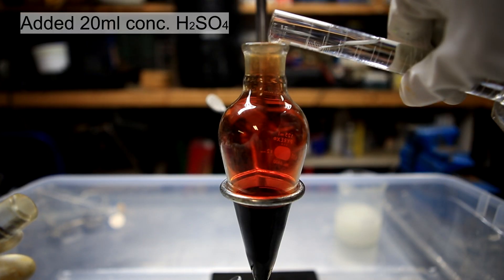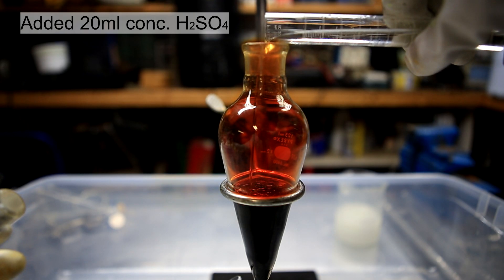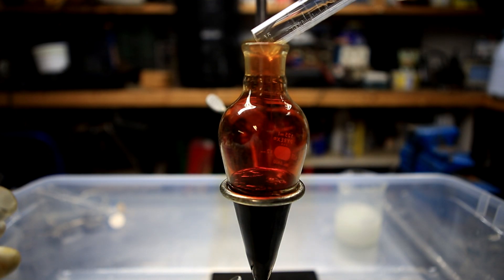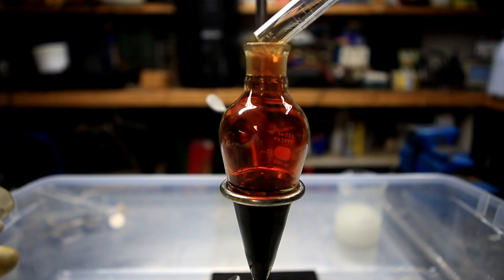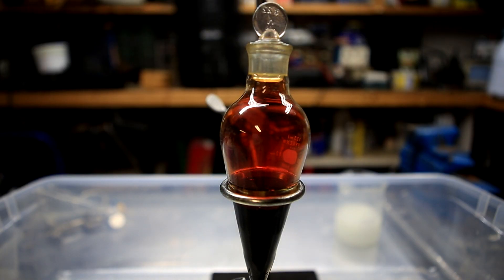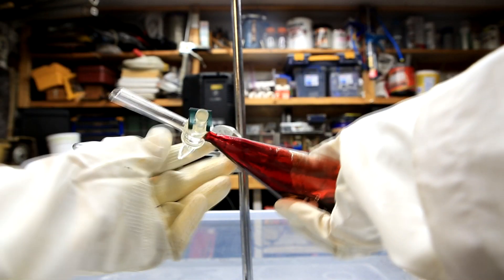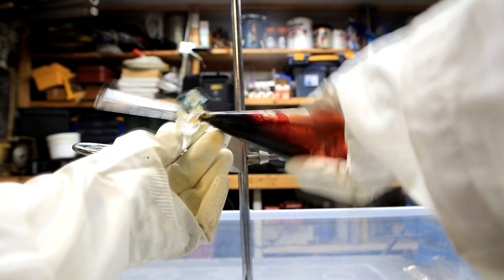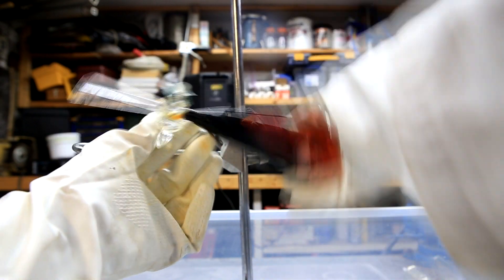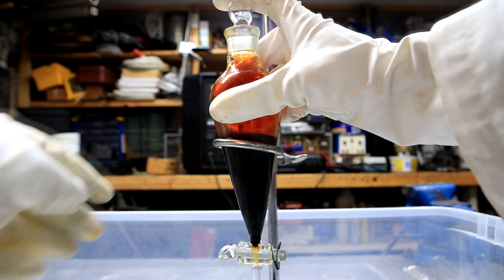To the bromine was added 20 milliliters of concentrated sulfuric acid. This step must be done very carefully because if water is present, it can be very exothermic and cause the bromine to boil. The next part is the most dangerous part, which is capping and shaking to mix the sulfuric acid and the bromine. It is important that the stopper is well greased with sulfuric acid to make sure that no bromine leaks out. When the separatory funnel was capped and shaken, no pressure was created and no bromine was released when I vented the stopcock. However, this is highly unusual and it should be expected for bromine vapors to shoot out when the stopcock is opened.